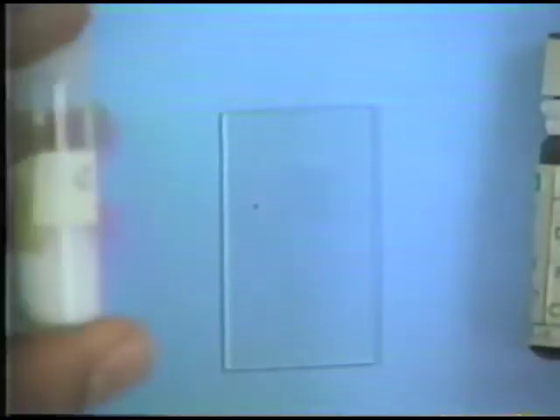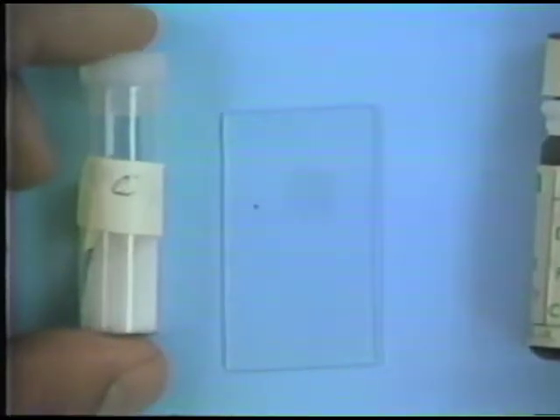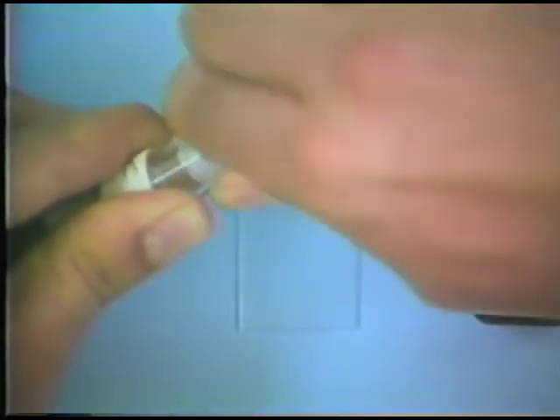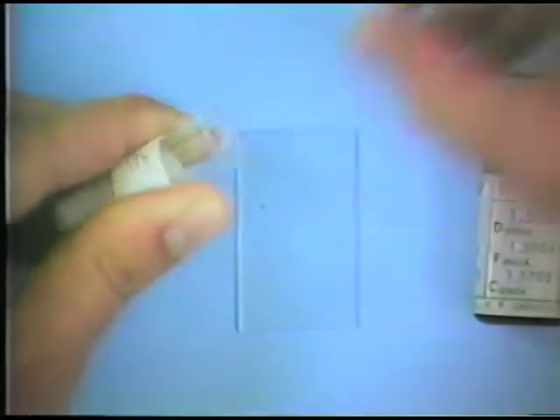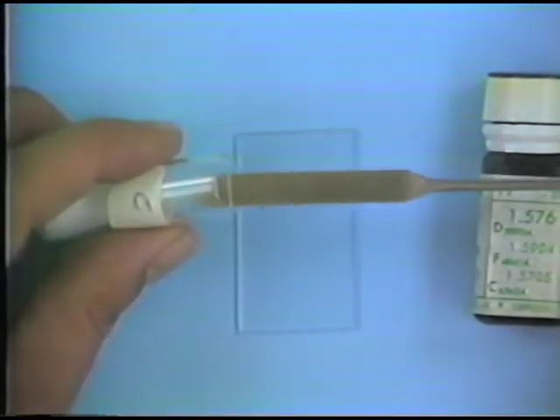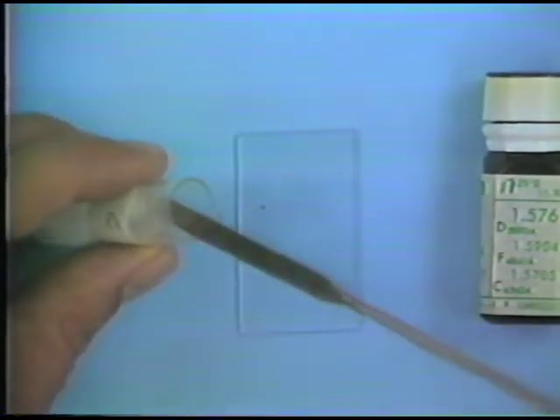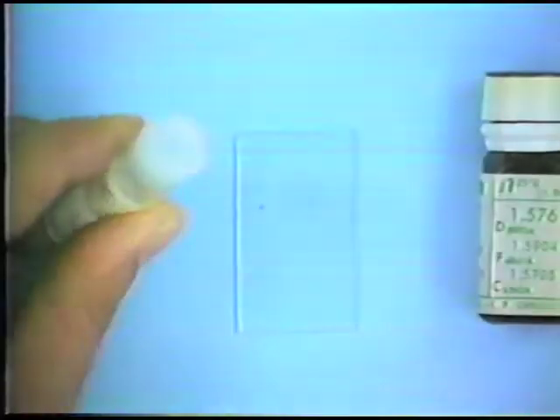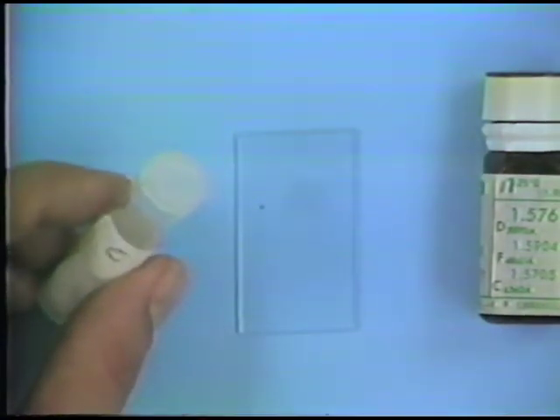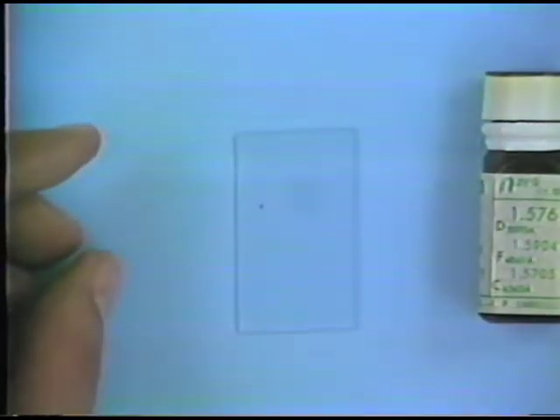And I'm going to take my mineral grains, which are stored here in a vial, and transfer some of them to this mount and combine it with the index of refraction liquid. So I'll just extract the mineral grains here and place them on the glass slide, just a few of them. And actually, if you're dealing with isotropic minerals in particular, you don't need many of these mineral grains at all. I've put about 15 or 20 of these mineral grains on the slide, which is plenty for isotropic minerals.